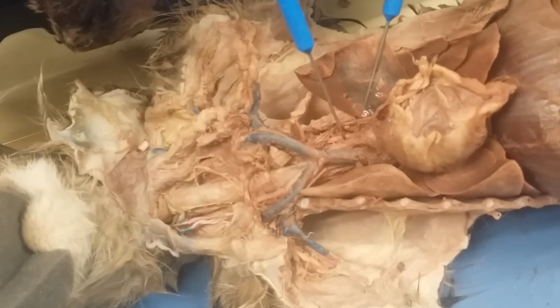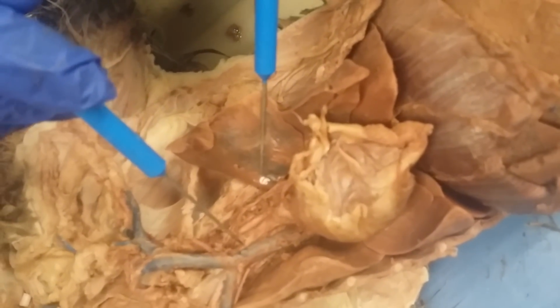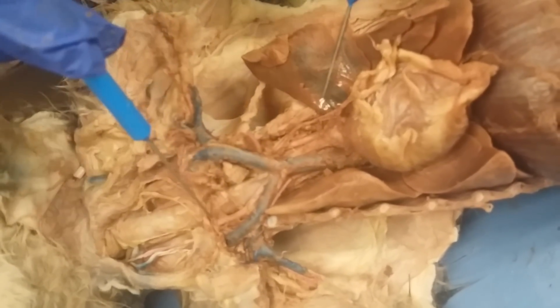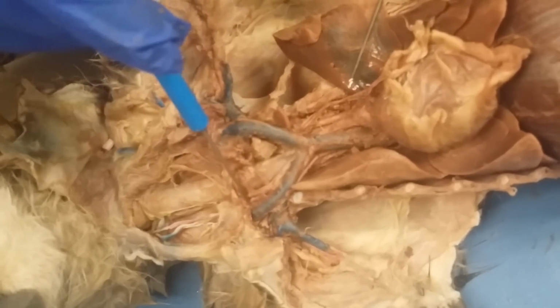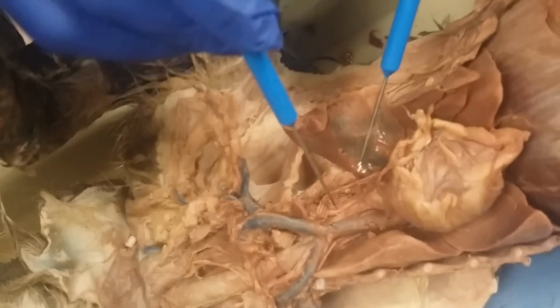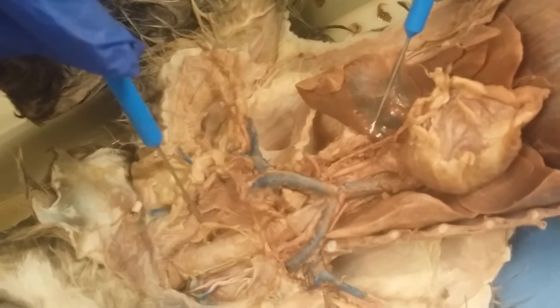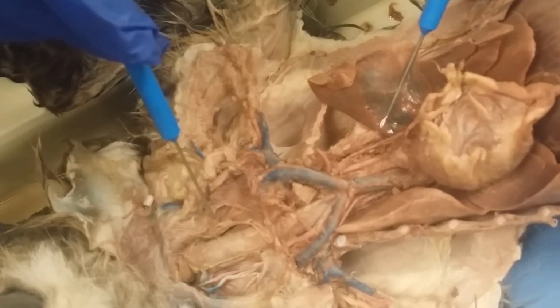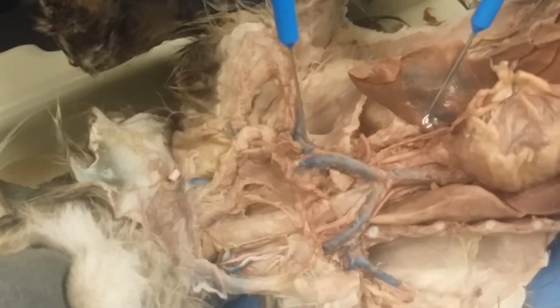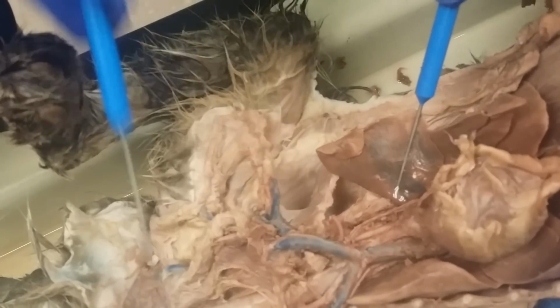You're gonna have the right brachiocephalic artery coming right off the ascending aorta, the aortic arch, which comes over here, which splits up into the subclavian artery, and then the right carotid artery, which will go up here. And then you're going to have the left common carotid artery right here coming off the aorta, which goes up, which you'll also find right here, it looks like. Subclavian artery right here, of course, underneath it.